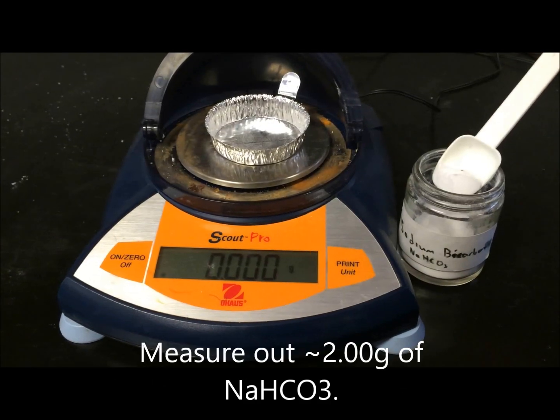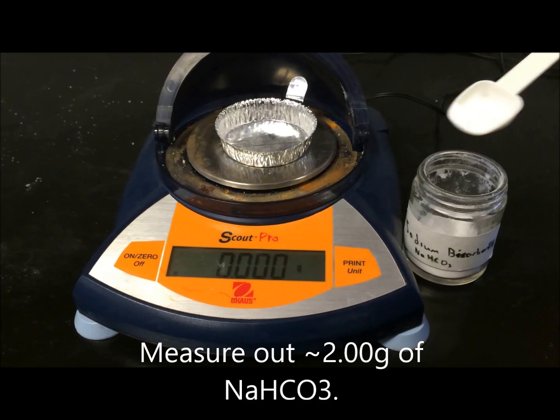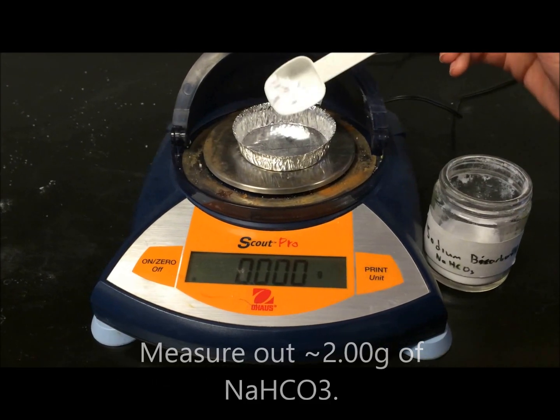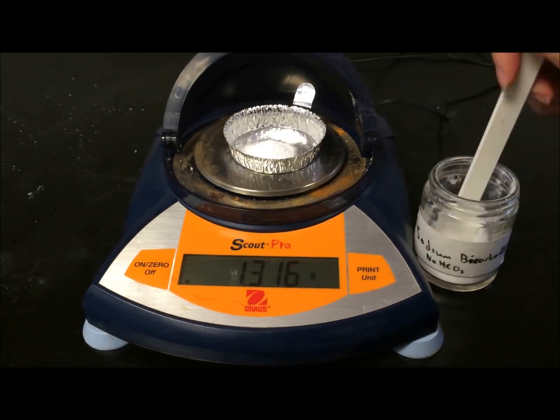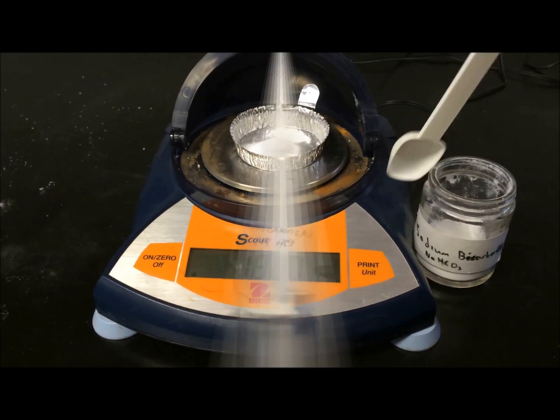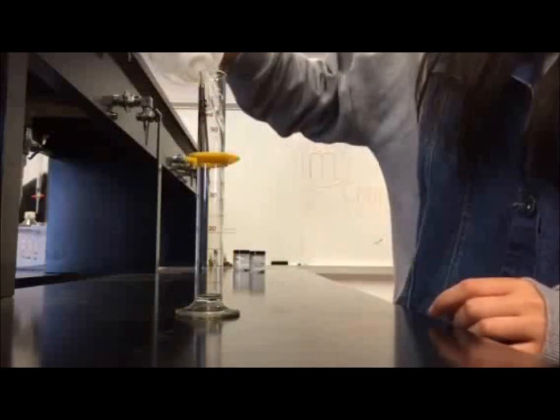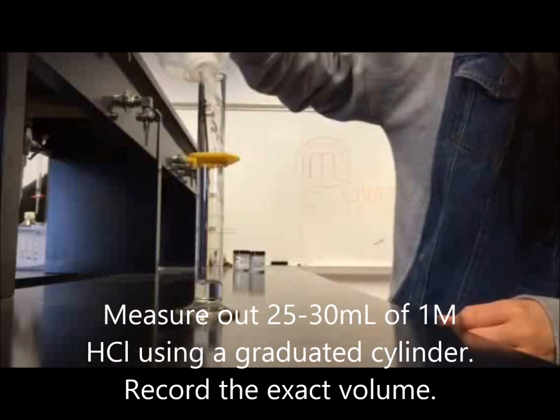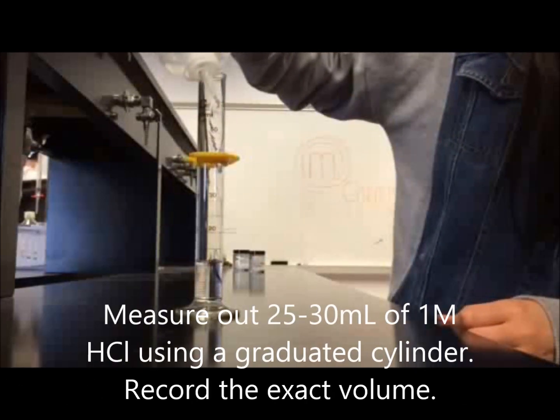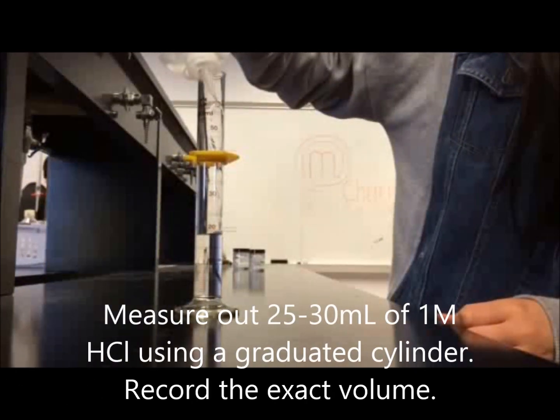Measure out 2 grams of sodium bicarbonate, also known as baking soda. Now we need 1 molar HCl. Measure out 25 to 30 milliliters in a graduated cylinder. Record the exact volume.